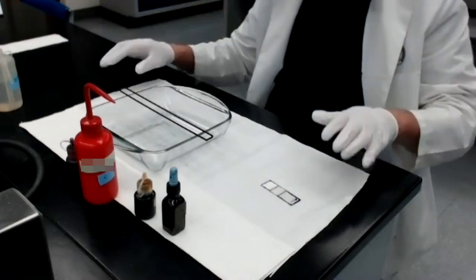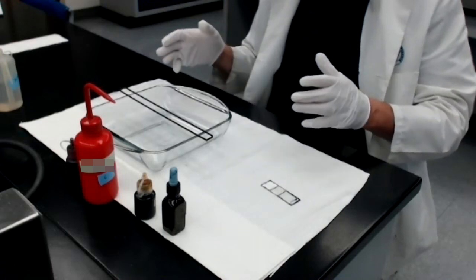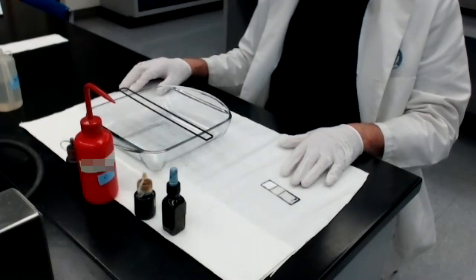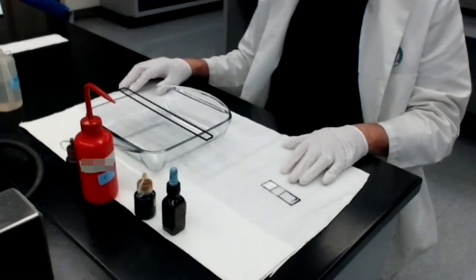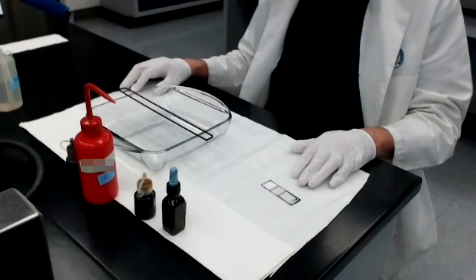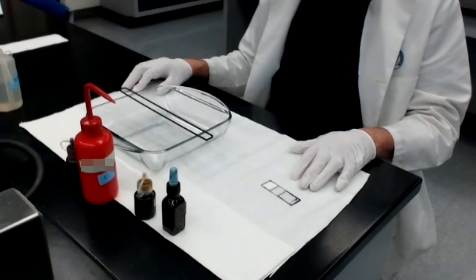The Gram stain is a type of differential stain that is meant to divide bacteria into two groups based on how they stain with the Gram stain. If at the end of the staining process they have stained purple or bluish black, they are considered to be a gram-positive bacterium. If, on the other hand, at the end of the staining process, they have stained a pink or reddish color, they are considered to be a gram-negative bacterium.